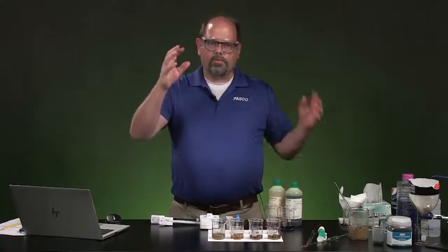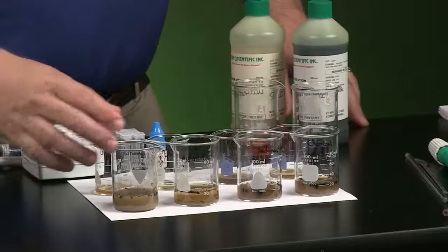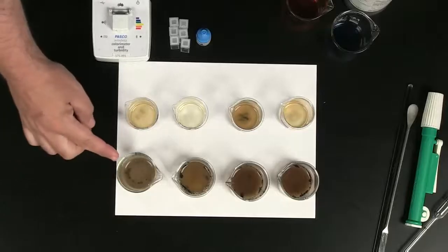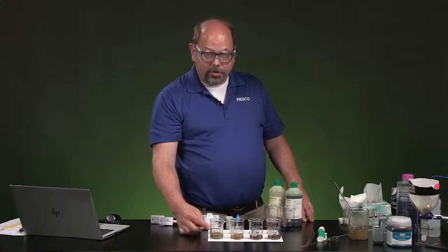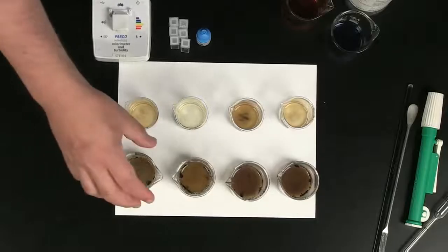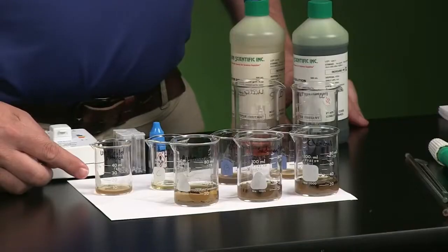So we've given the water that we've just filtered some time to make it all the way through. For instance, this is just the water as it was. You can look inside, and again, it looks sort of like chocolate milk. But as I poured it straight into a filter after stirring it, I resuspended everything and put it through a filter. Here's what that ends up looking like, just through the filter once.